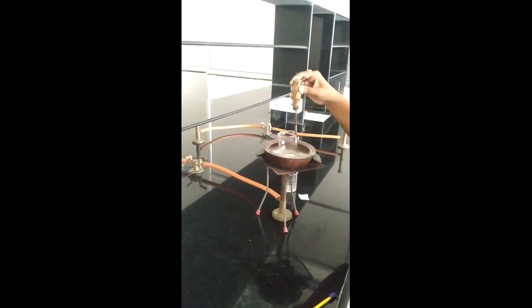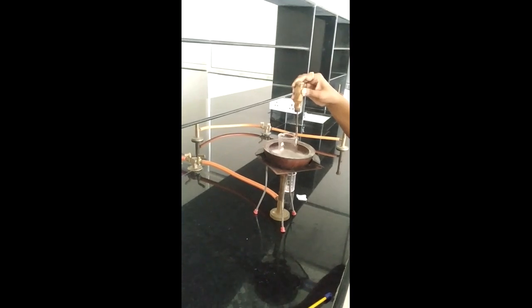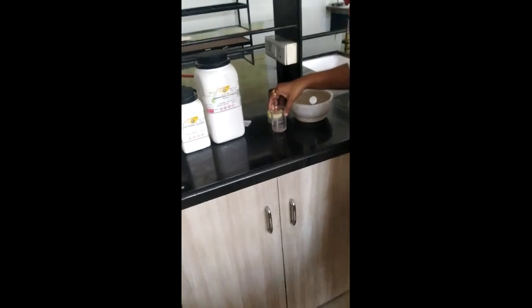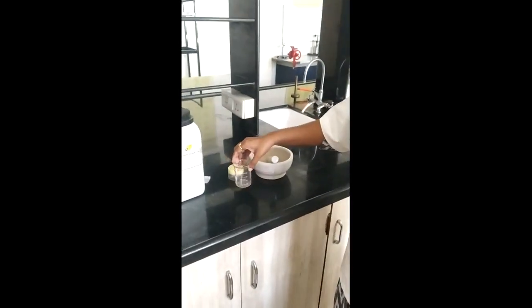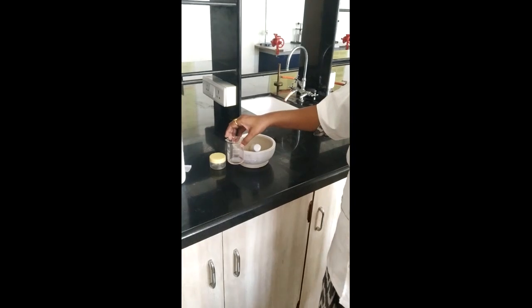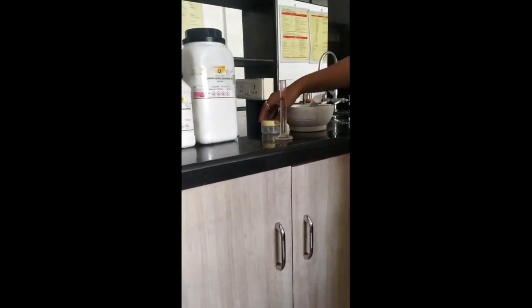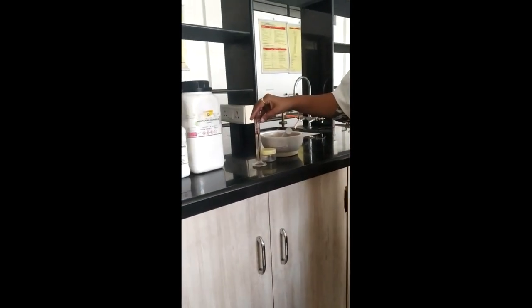After proper mixing and heating, now we will cool it and then proceed to the next part. So now after melting, this solution has become cool. Now we will move to the volume makeup. So now I make up the volume up to 10 ml. Now I am going to transfer it into this container, and then we will proceed to the labeling part.